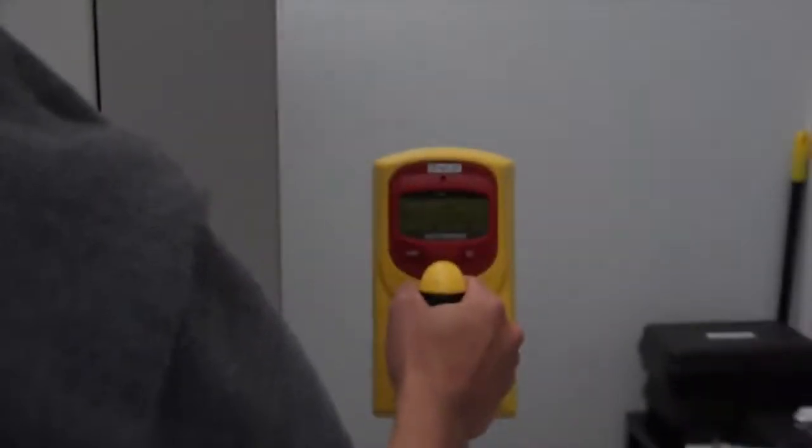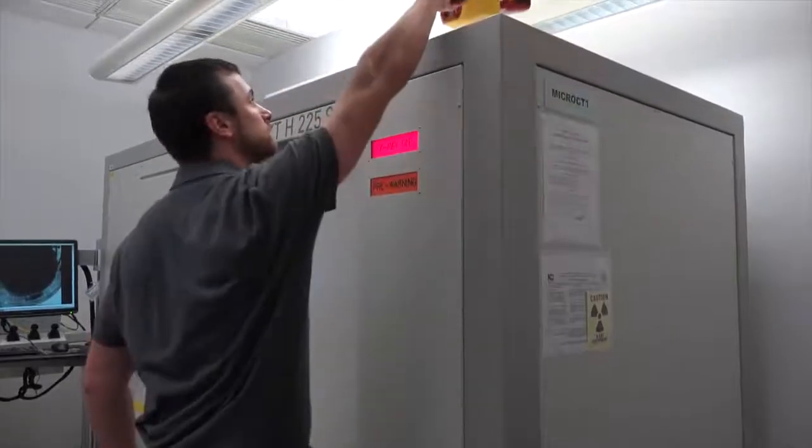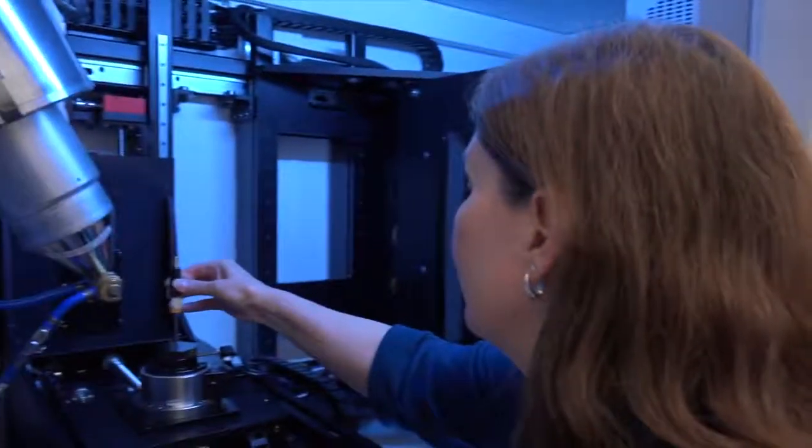Because of all the safety features and protocols, no extra protective equipment needs to be worn when operating the MicroCT. Now, let's discuss the operation of the MicroCT. We will be using a USB drive as our sample.